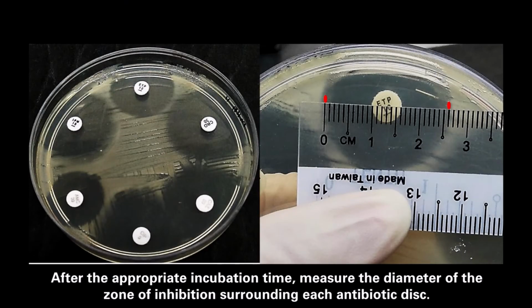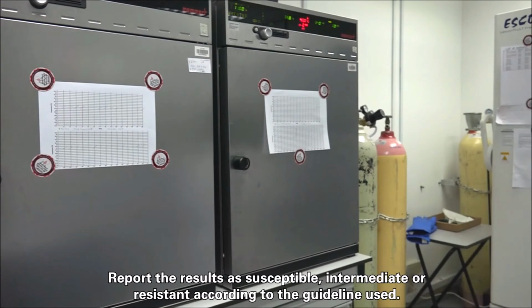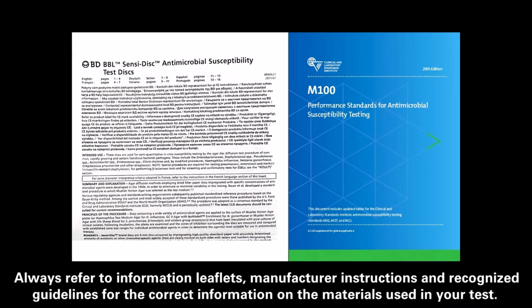After the appropriate incubation time, measure the diameter of the zone of inhibition surrounding each antibiotic disc. Report the results as susceptible, intermediate, or resistant according to the guideline used. Always refer to information leaflets, manufacturer instructions, and recognized guidelines for the correct information on the materials used in your test.